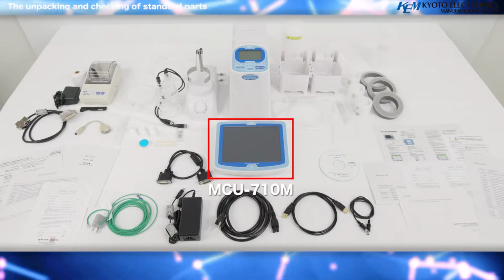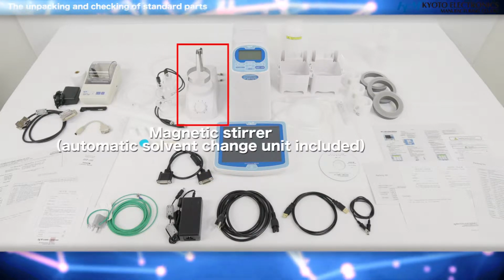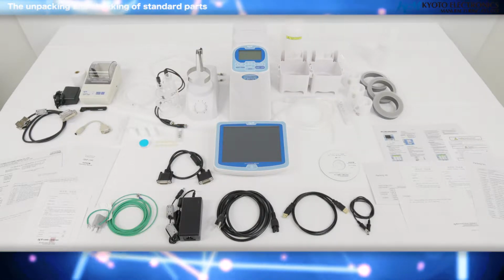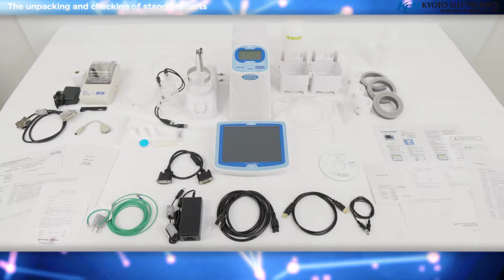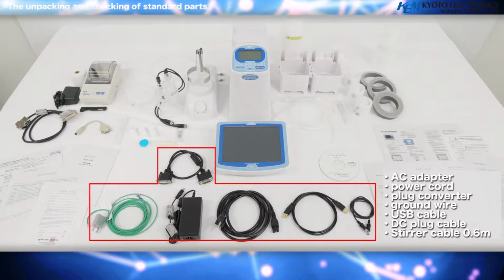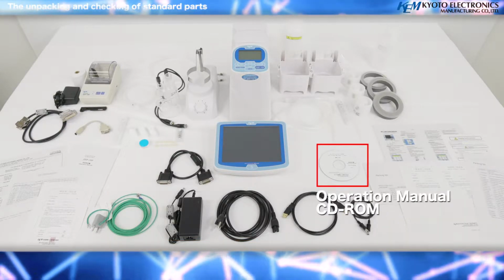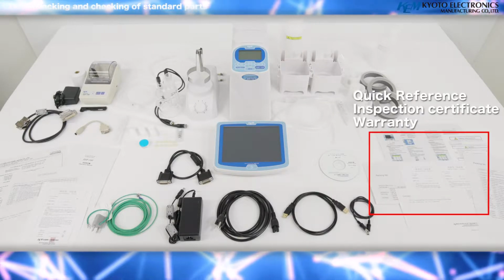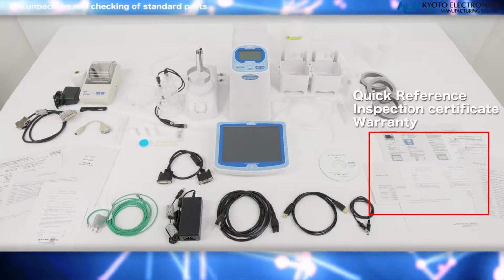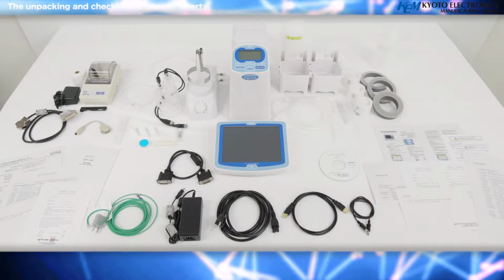MCU 710M, Magnetic Stirrer, Automatic Solvent Change Unit, Titration Cell Unit, AC Adapter, Power cord, USB cable, DC plug cable, Operational Manual, CD-ROM, MKC710 Quick Reference, Inspection Certificate, Warranty, Contact, Packing List.